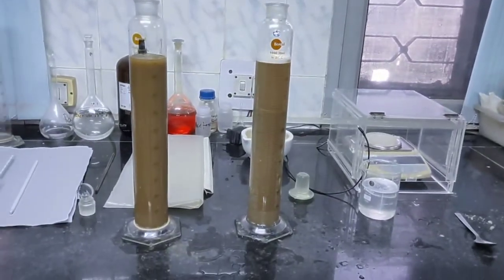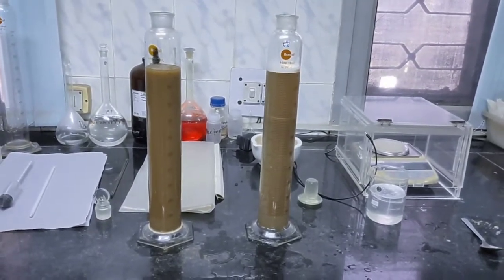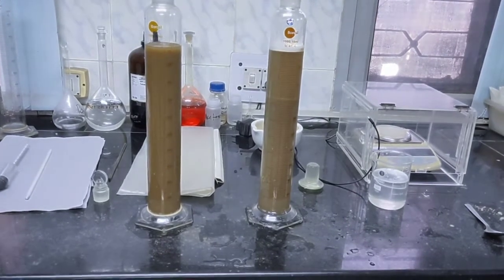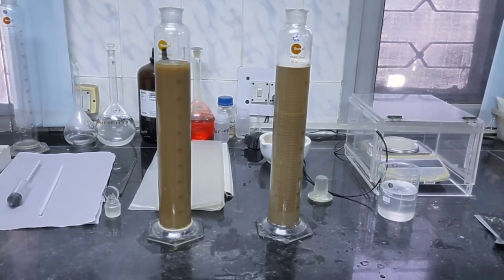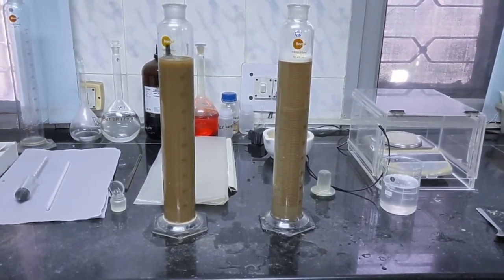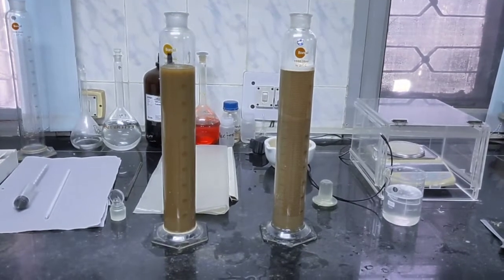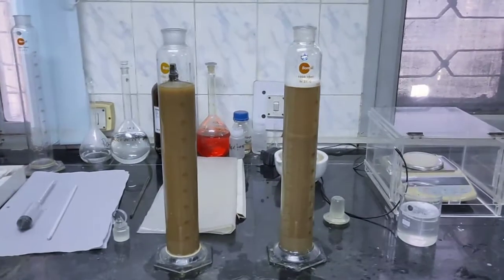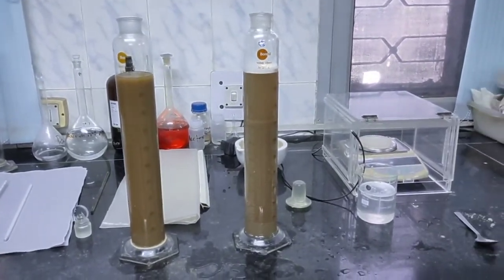The organic matter has been oxidized by H₂O₂ and you can find there is effervescence — a lot of froth forming. After a certain time it will subside. You then put the sample into a water bath to get more and more carbon dioxide to evolve, meaning the organic matter is going away.